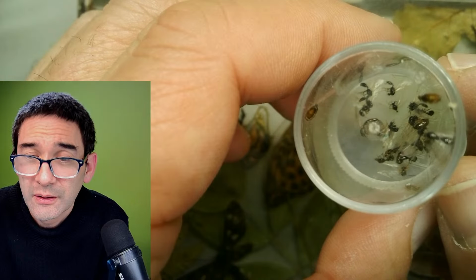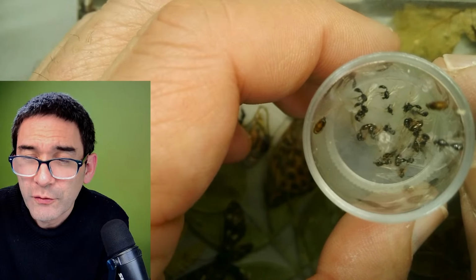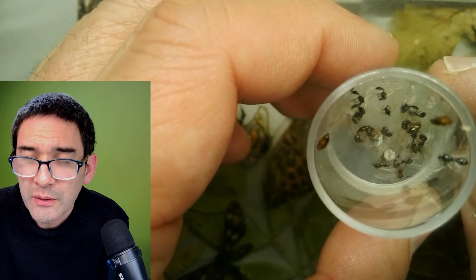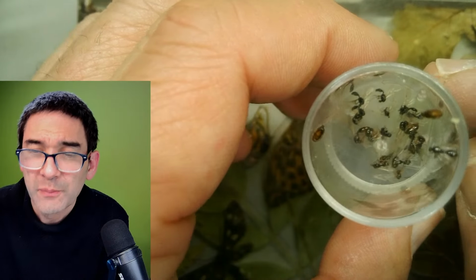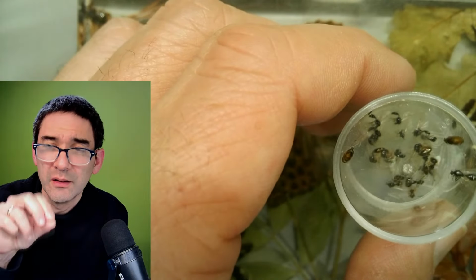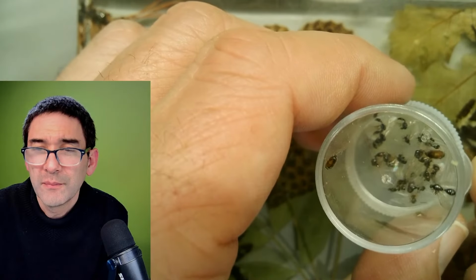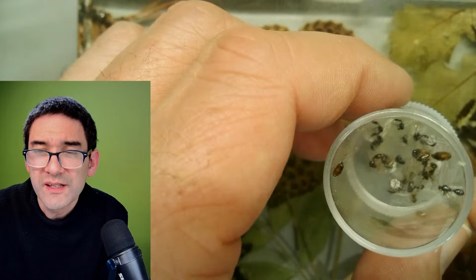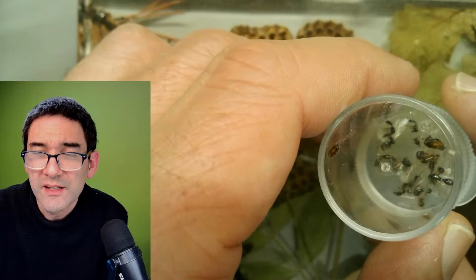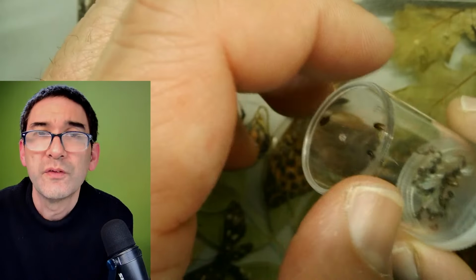Electric discharge on a piece of copper tape or something, or like a spot weld under the scope. So basically, if you have an electric spark, maybe that makes a trail, maybe in wood. Okay. No worries if it isn't interesting. It's a question of trying and seeing. I also agree with you. Even if it's not very interesting, then we've still learned something.